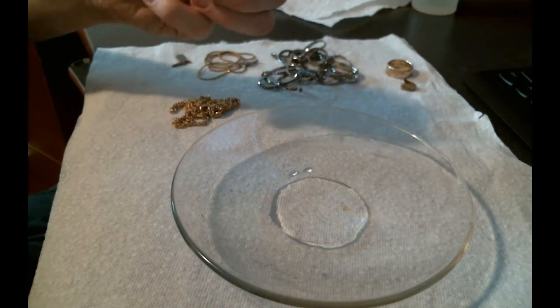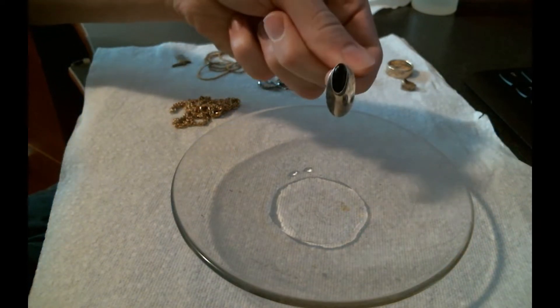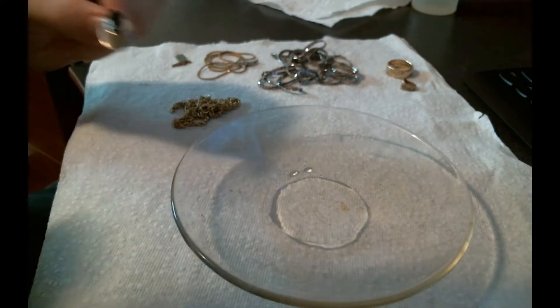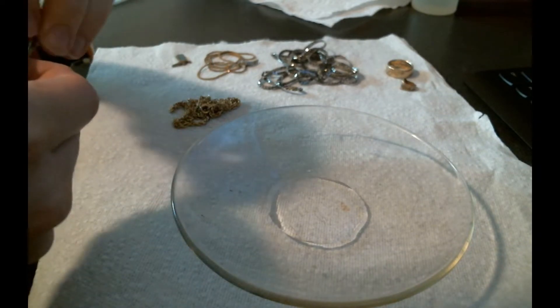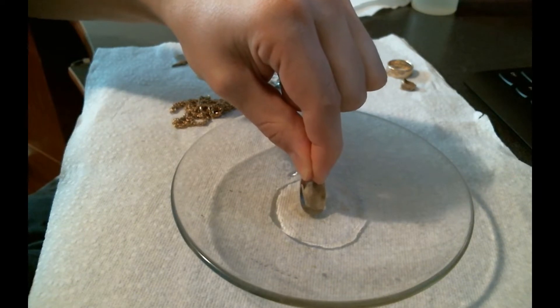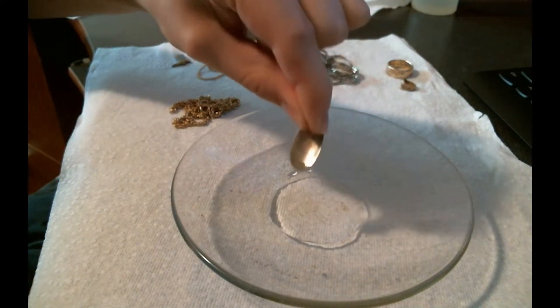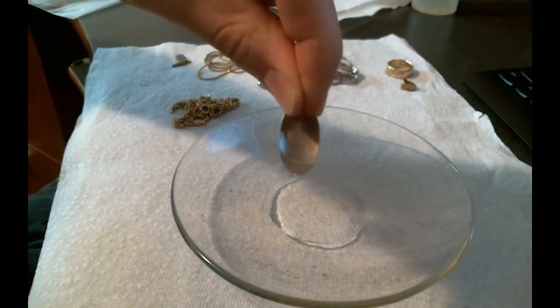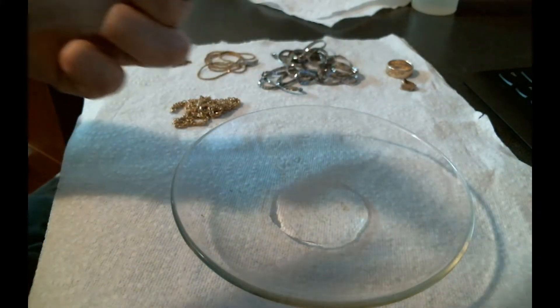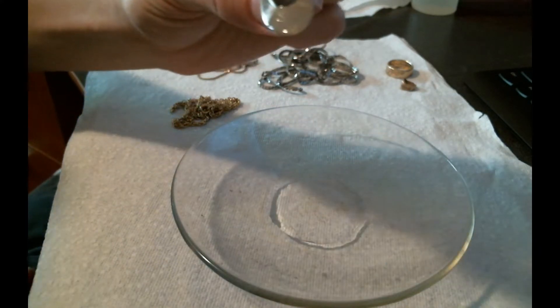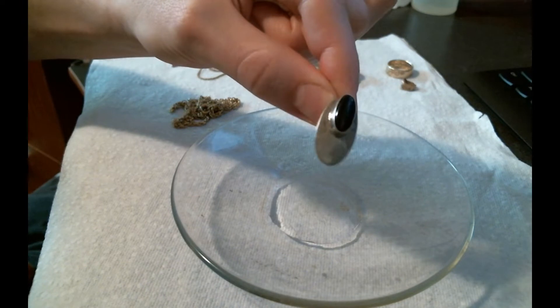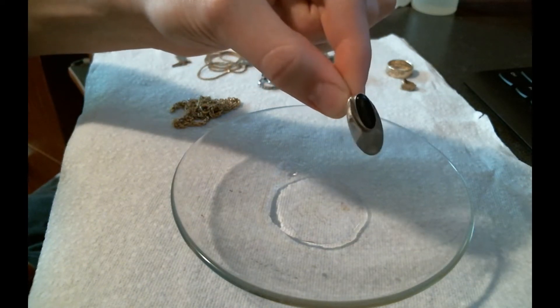Here I've got this sterling silver earring. Interestingly, you will notice a reaction or a change in color. If I put this in the acid, it starts to dissolve the silver and some of it replates on. As you can probably see, it has discolored the silver.